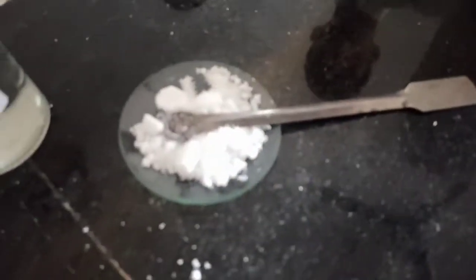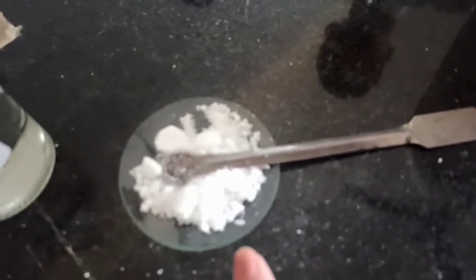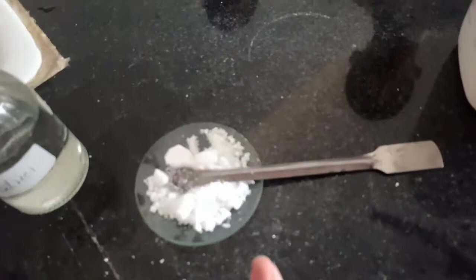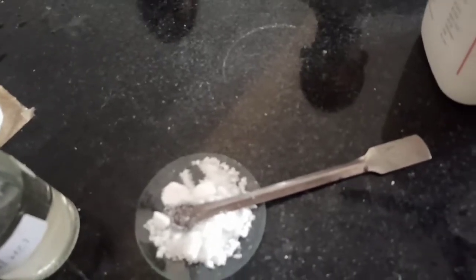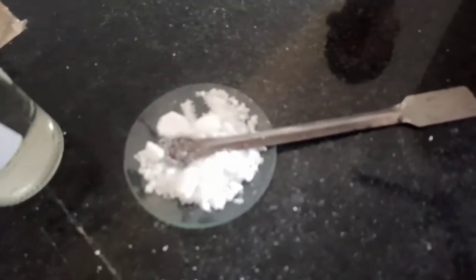See, this is the white salt which has been given by the teacher. Okay, Mustafa and Soumya, this is the white salt which you are getting for testing what it actually is. This is white in color, and white is called colorless in chemistry, right? White is considered colorless because it does not have any particular color out of the 7. So either you say colorless or you say white, both mean the same. Then it is having a characteristic ammoniacal smell. So the cation may be ammonium, okay?